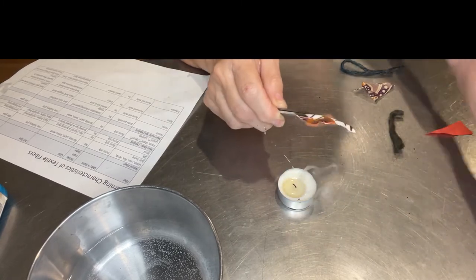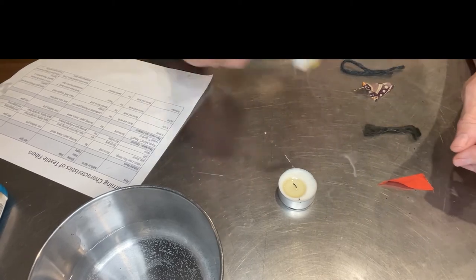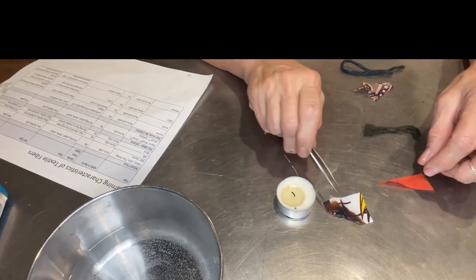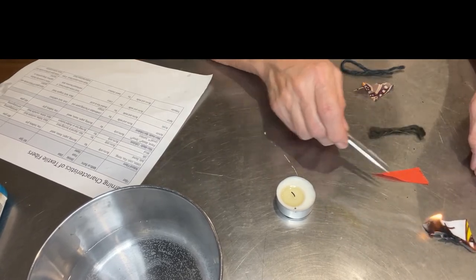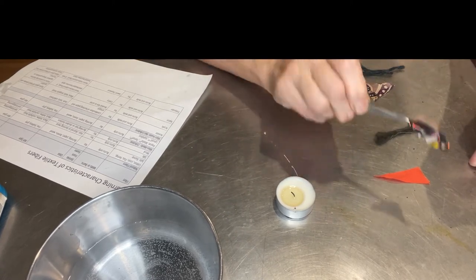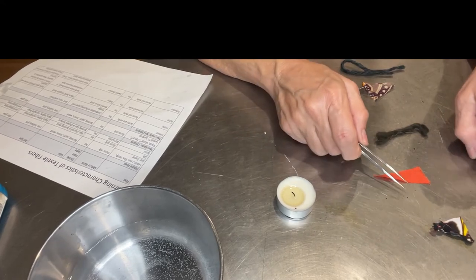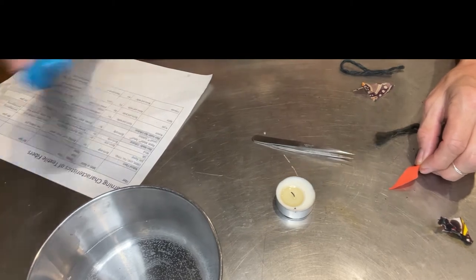It's got glowing edges — and I just lost all my swatches. There you go — this is why you have a table that is burn-proof. It's going to keep going, so just be aware this kind of stuff happens. The ash is soft and gray. I'll let it sit there for a bit.